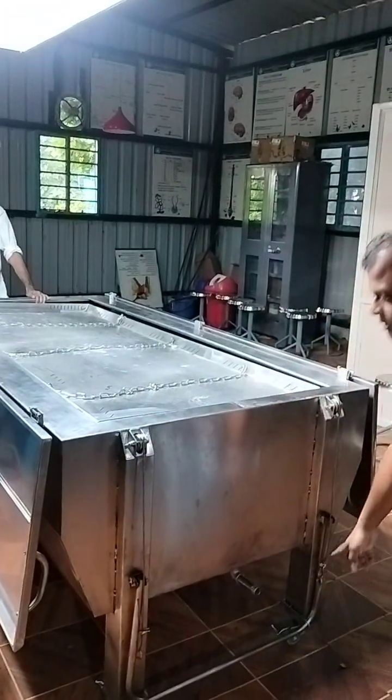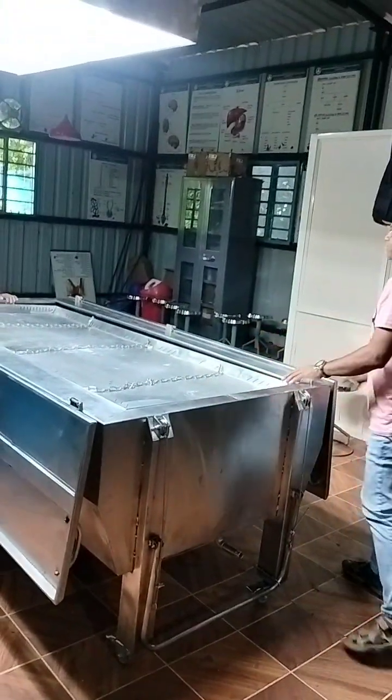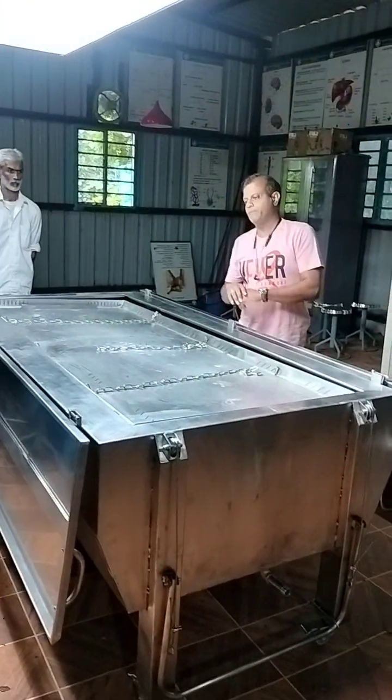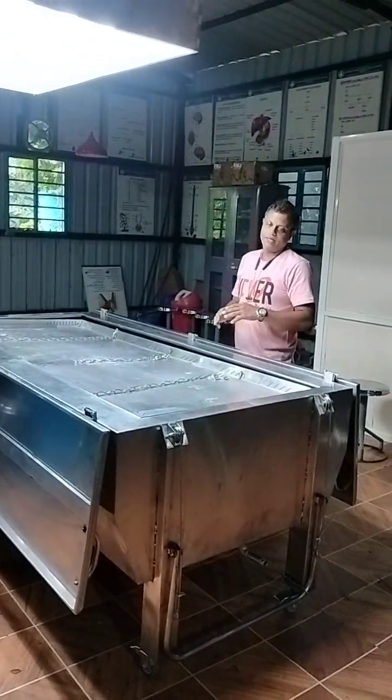This is the way you have to lock it. Once it is locked, the body will fit on top of the frame. So this is where the body will be, and these are the things that hold the body. If you want to put the body inside the cabinet, the body will have a preservative to ensure it doesn't deteriorate.